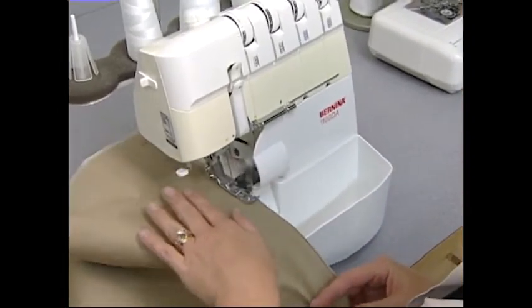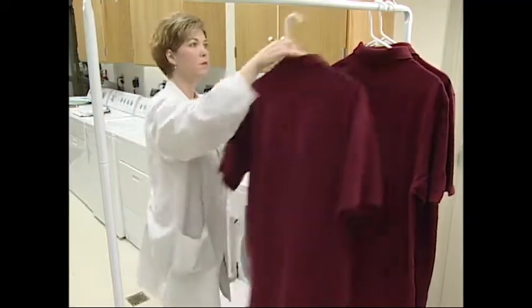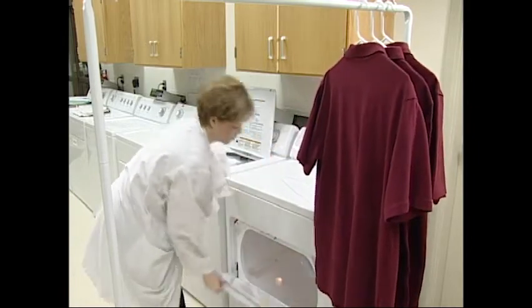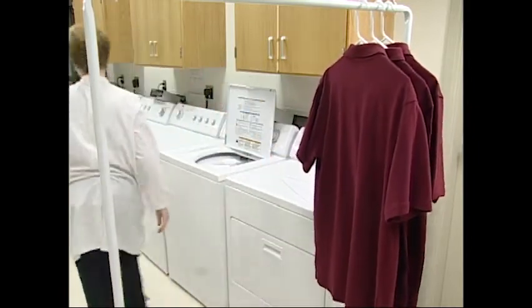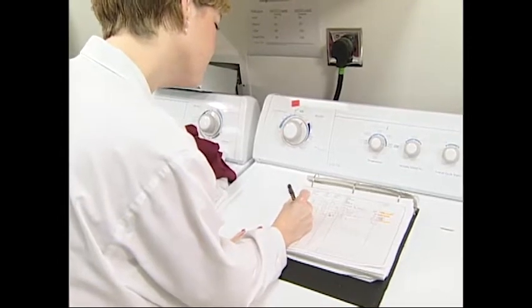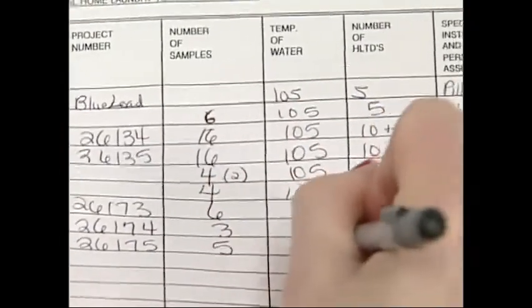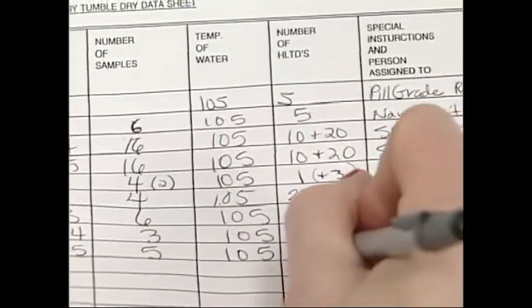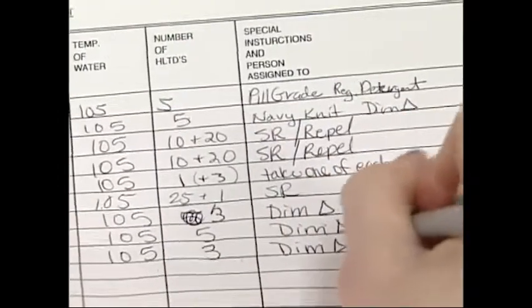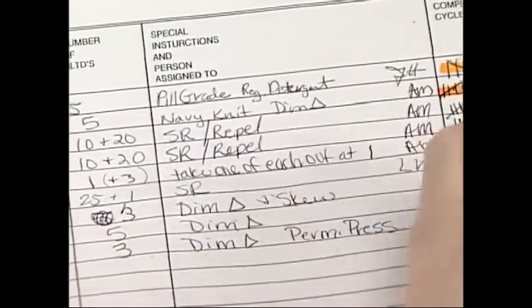The washing and drying machines in the testing step don't have to be located in a standard conditions laboratory due to the heat and humidity generated in laundering. Each sample's identification should be entered into a log book in the laundry. The information should include the ID number, the number of specimens, washing and drying conditions, the cycle instructions, the type of detergent to be used, and any special instructions.